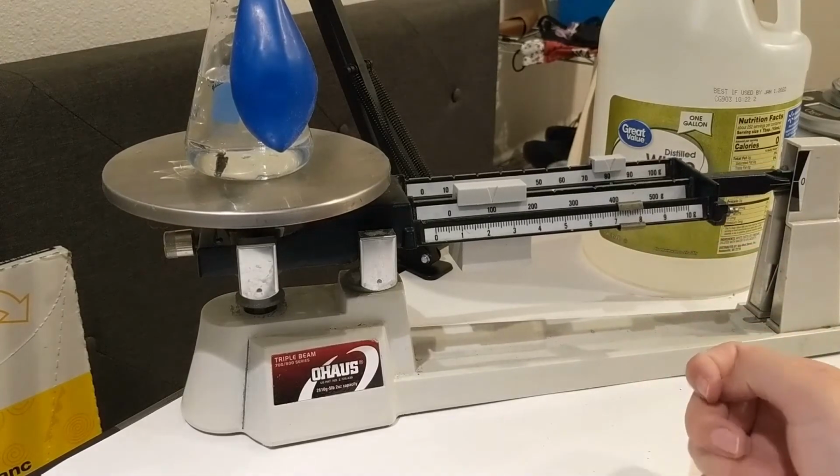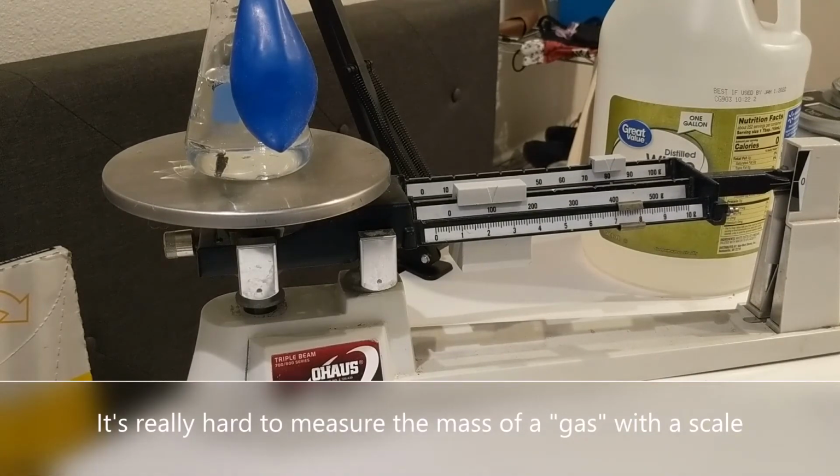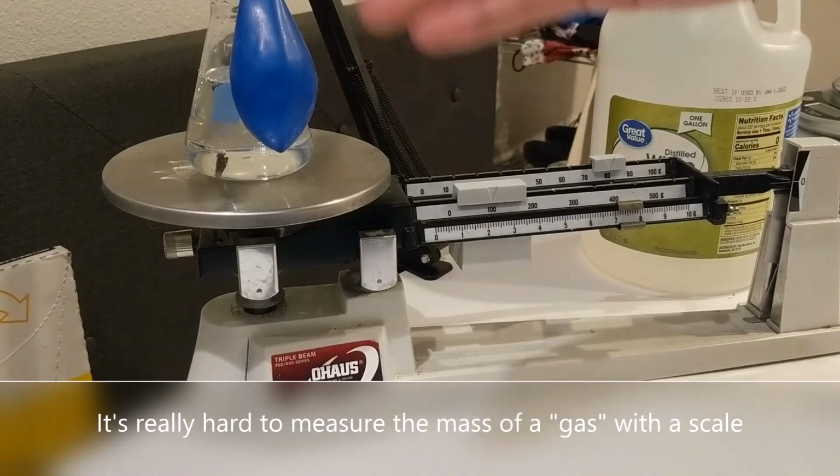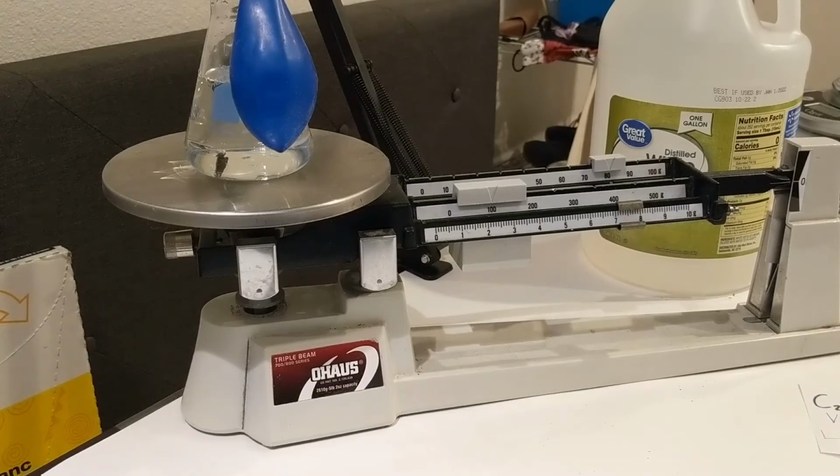187.6 it looks like. So we need to know a little bit of physics for this lab to work, so I'm going to explain it right now. In the atmosphere, it's really hard to measure the mass of a gas using a scale. As I pour the baking soda into the vinegar, we are going to see the reaction, and we'll notice that the scale appears like it is losing mass.